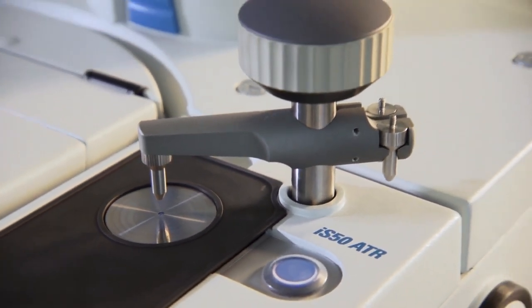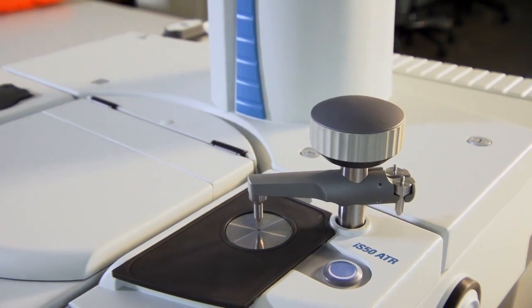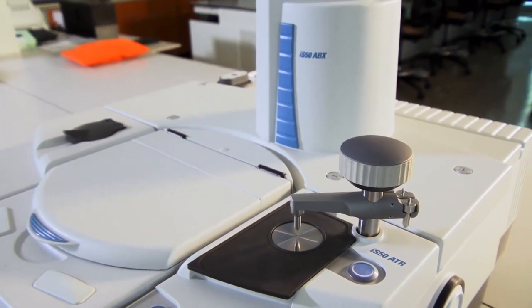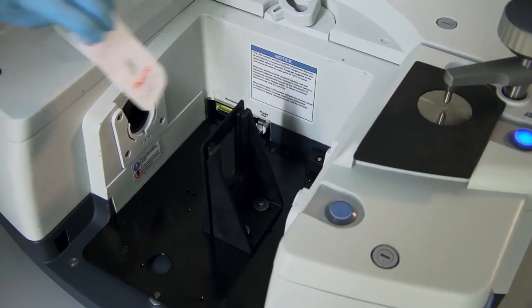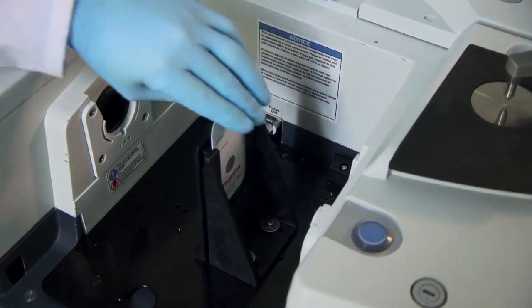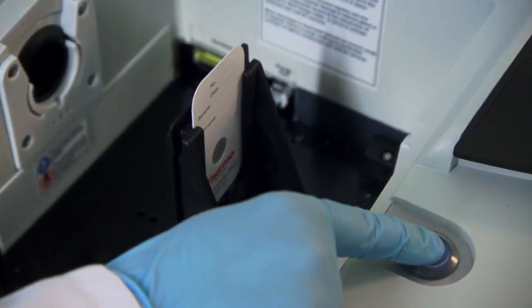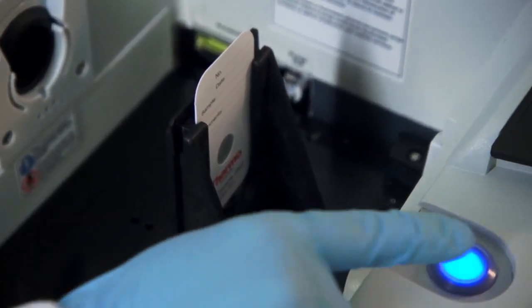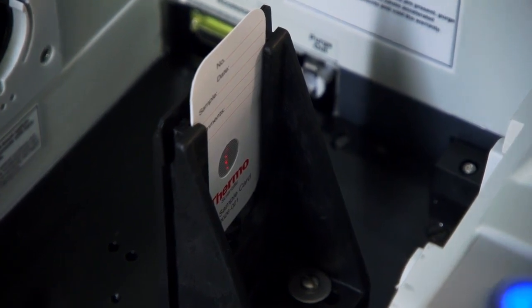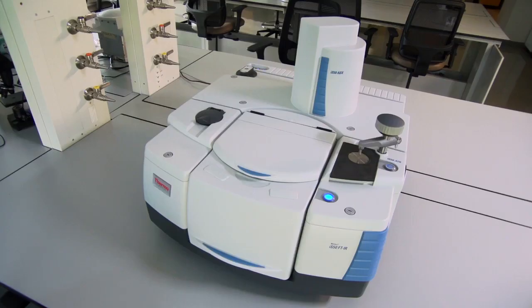An always-ready Diamond ATR sampling station, built right into the spectrometer, makes quick work of basic sample identification, leaving the main sampling compartment available for other sampling techniques, such as hot melt transmission analysis or even Raman spectroscopy.